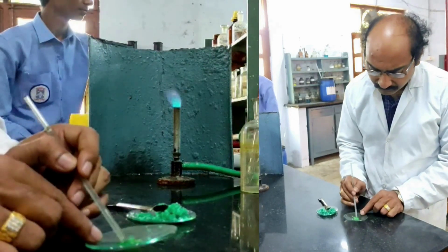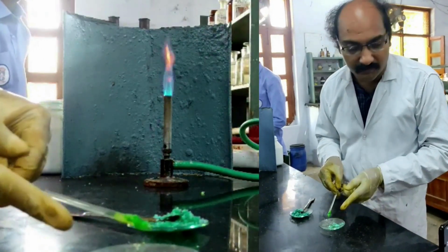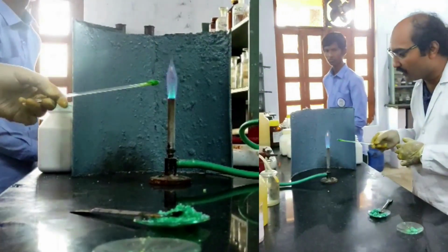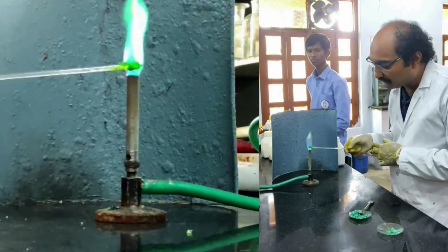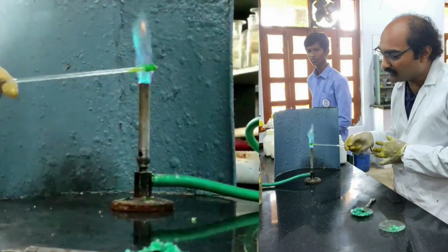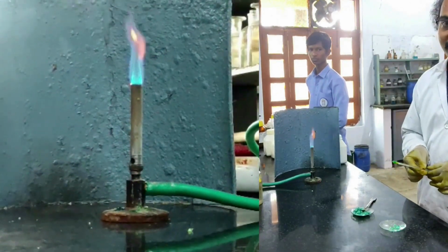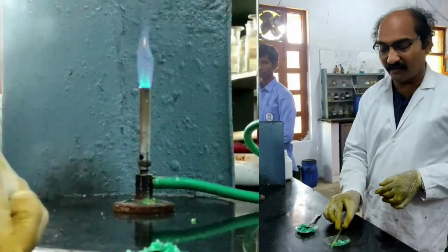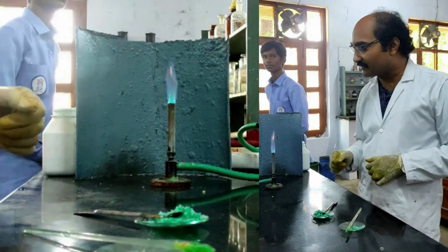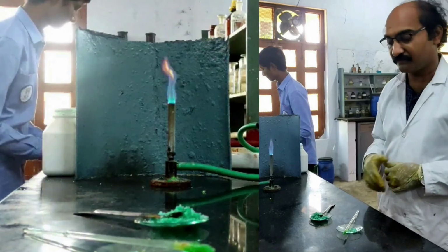You see, it is made like a paste. I have taken a small quantity of this paste onto a glass rod, and I am introducing this into the non-luminous flame of the Bunsen burner. I am getting flashes of green. Am I getting flashes of green here? Yes. So it may be indicating nickel in the flame test. So my inference is maybe a nickel plus 2, because I got characteristic flashes of green flame in the flame color test.